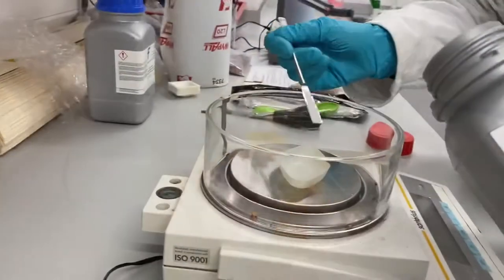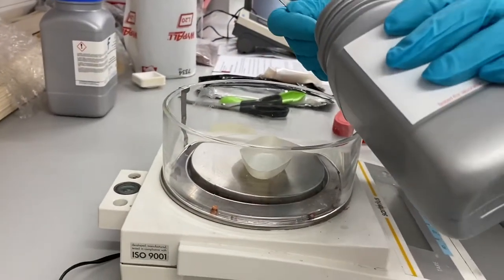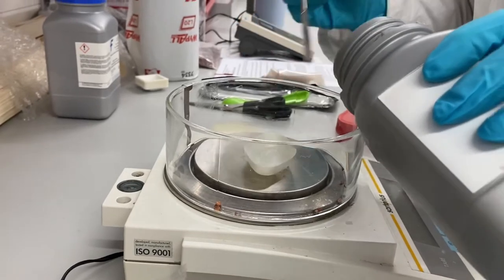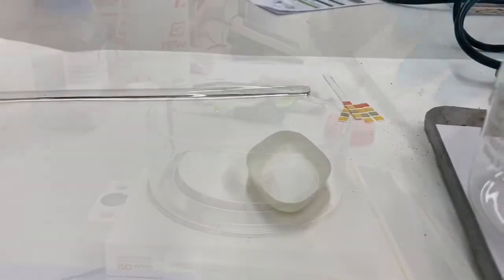After it's filtered we will carefully add 5 grams of potash alum to the warm solution and then reheat it to 70 to 80 degrees Celsius.